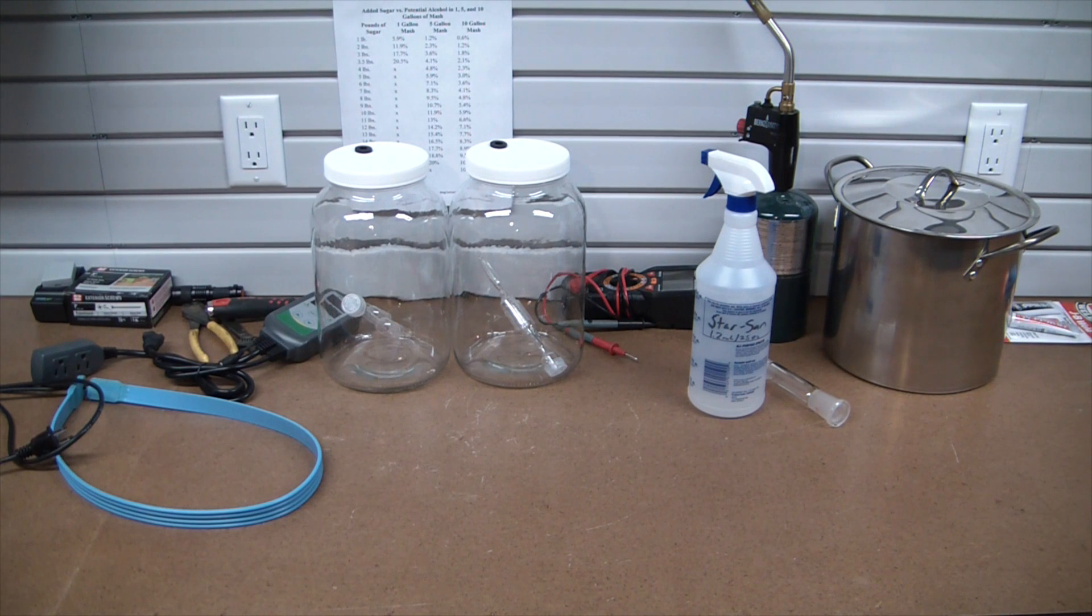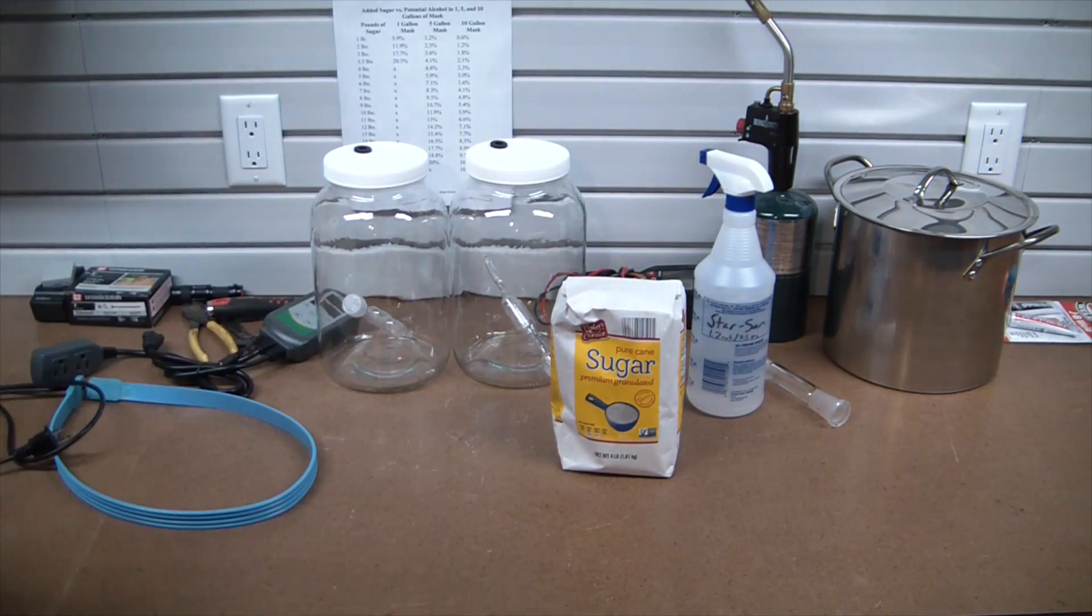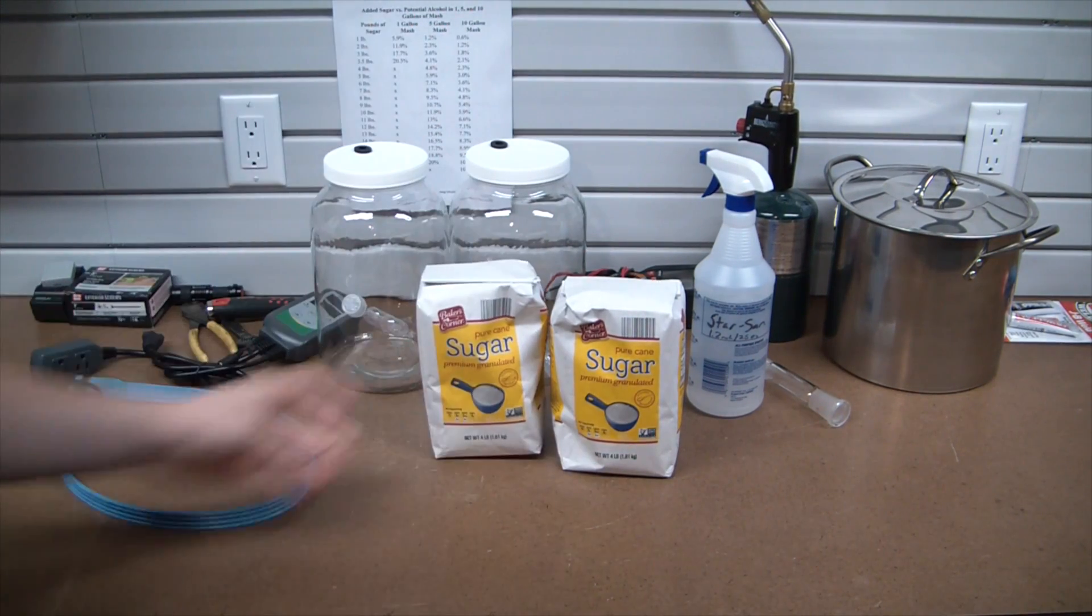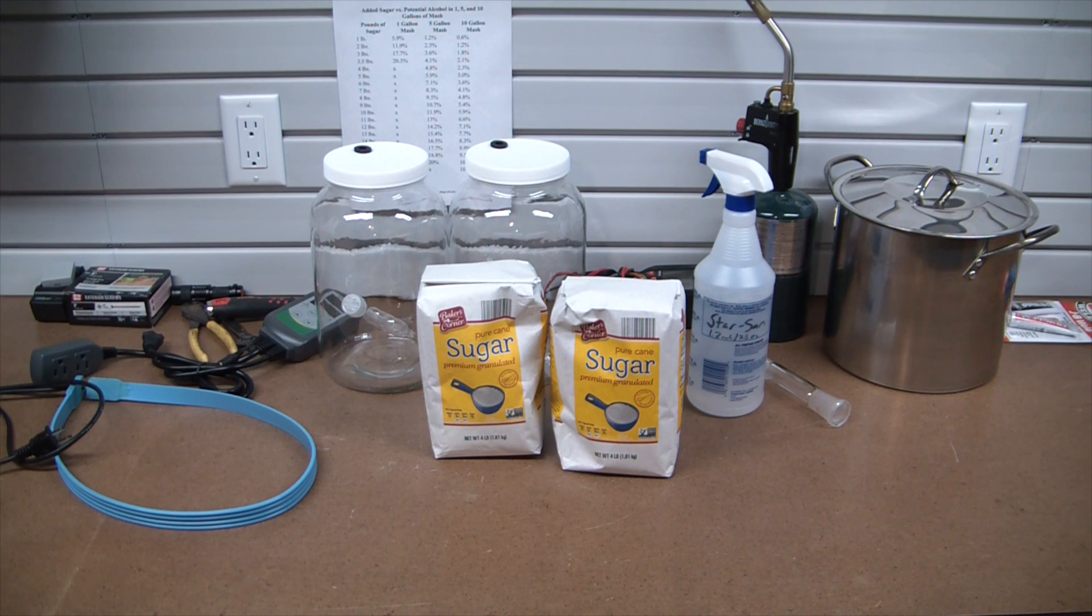Hey, what's going on guys, welcome back to the Elemental Maker. Today we are gonna be turning some cheap cane sugar from my favorite retailer Aldi's into pure anhydrous ethanol.